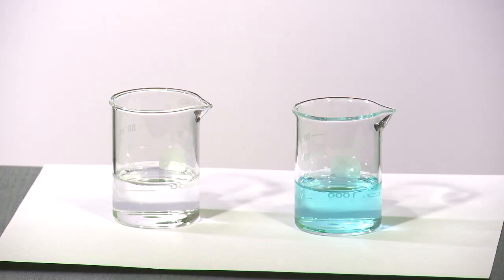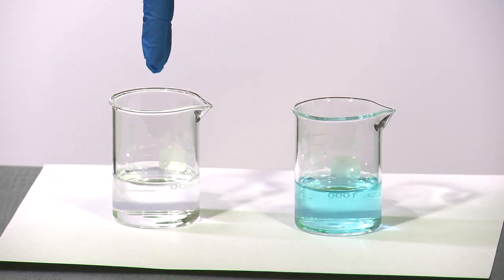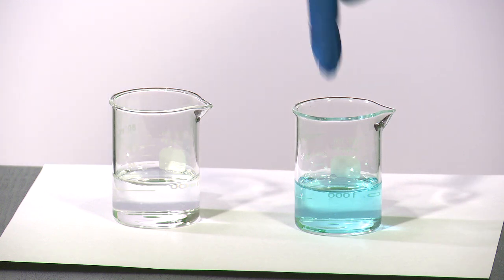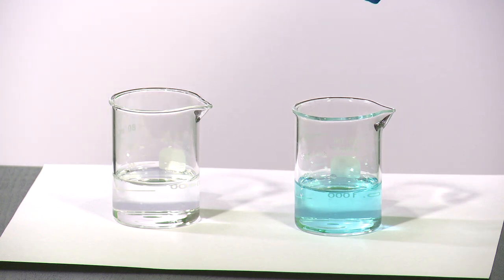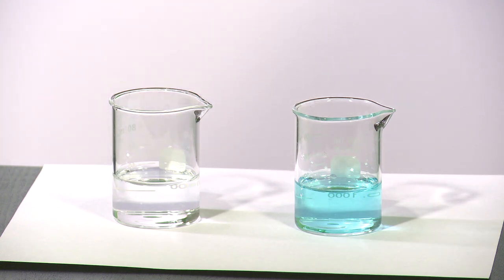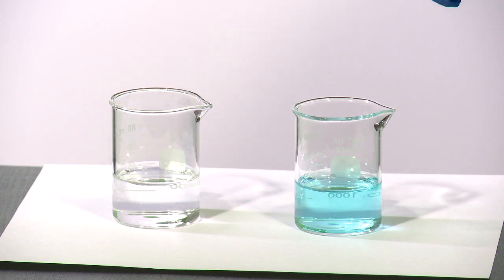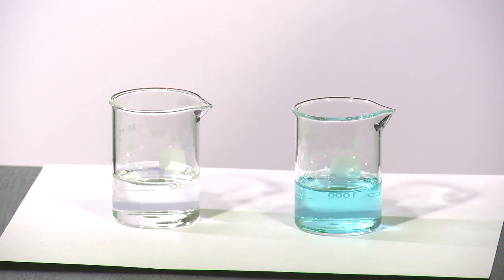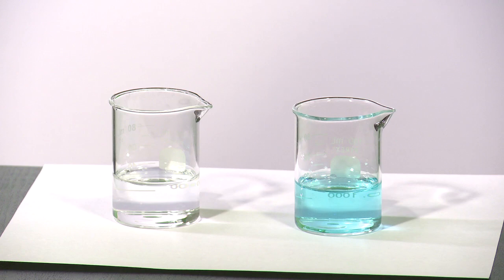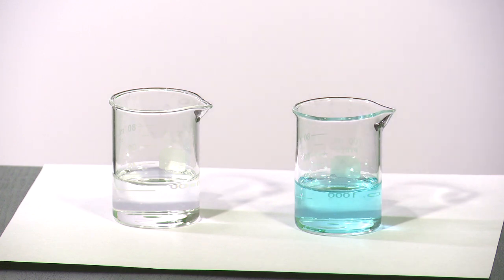I have here two solutions. This is sodium hydroxide and this is copper sulfate. Both are clear solutions. The copper sulfate has a blue color to it. I'm going to mix these two solutions together and see what happens.